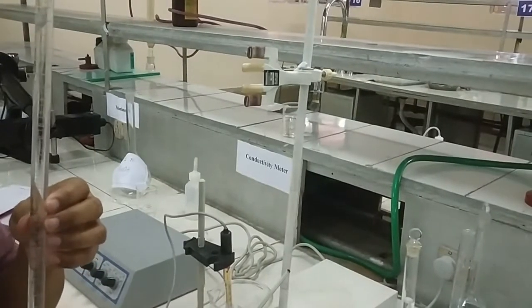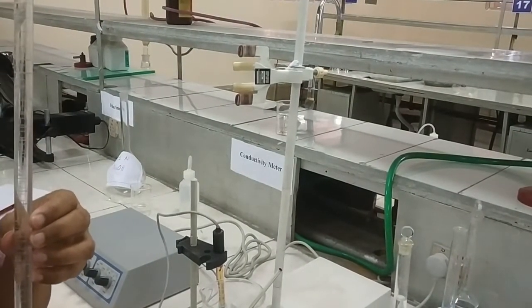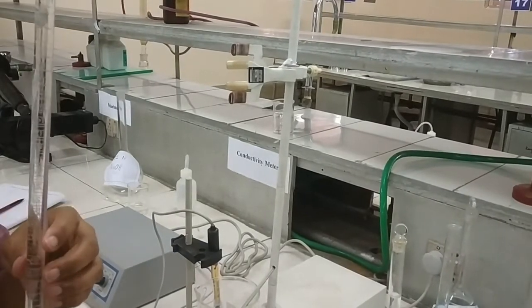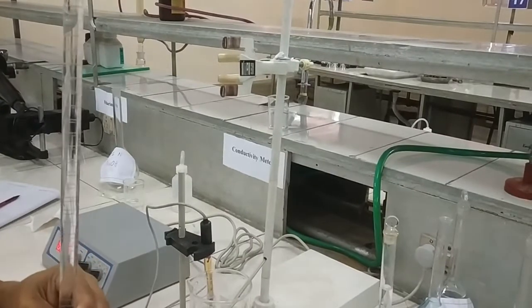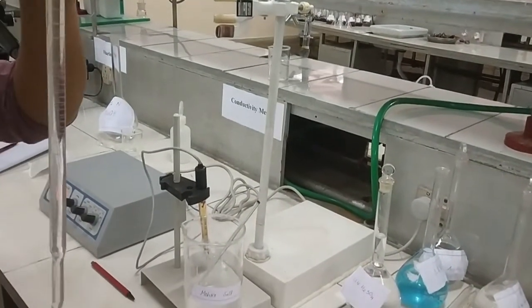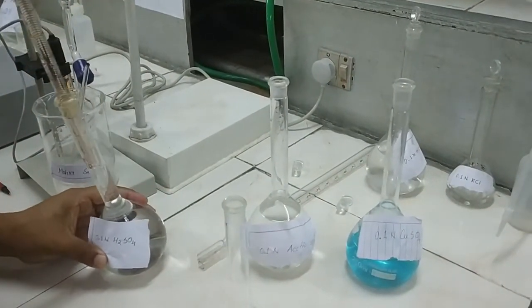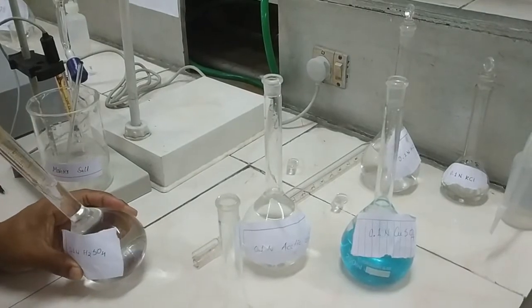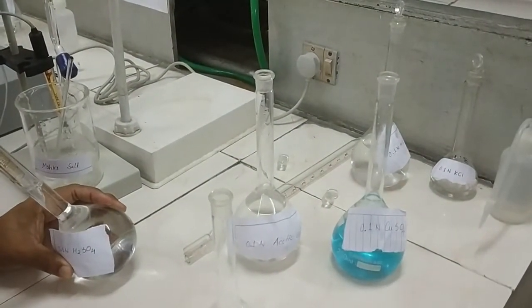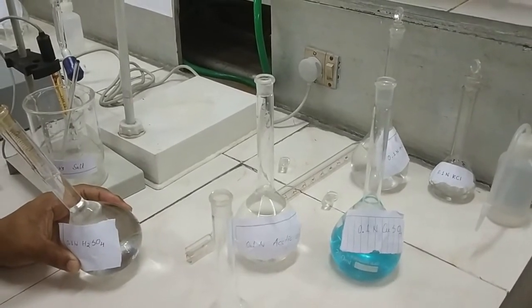For the titration of the mixture of sulfuric acid, acetic acid and copper sulfate, we are using standard sodium hydroxide solution. We have filled the burette with standard sodium hydroxide solution. Now, we are taking the mixture of sulfuric acid, acetic acid and copper sulfate — for this we have to take 5 ml of each of the compounds.